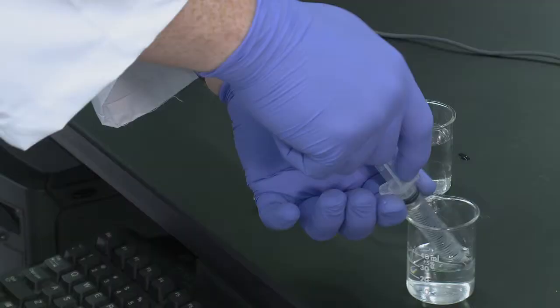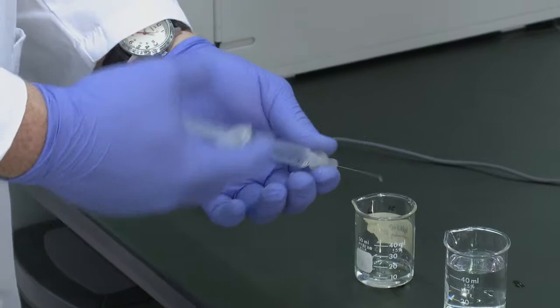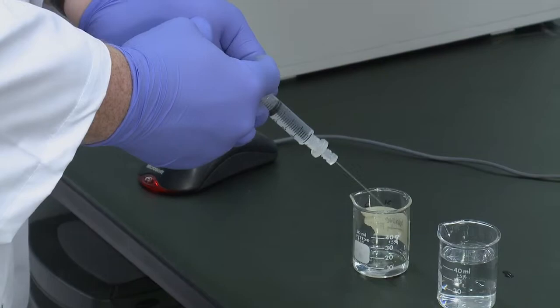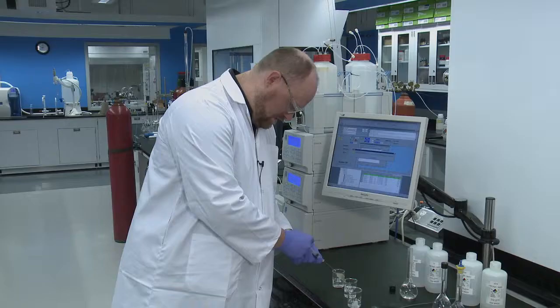And then what we're going to do is we're going to load the syringe with that. And then you're going to want to put the filter and needle back on and expel it to waste again, just to rinse out the filter and the needle.